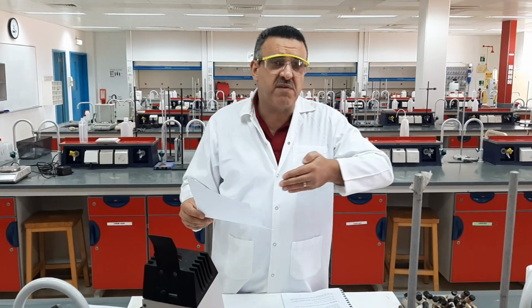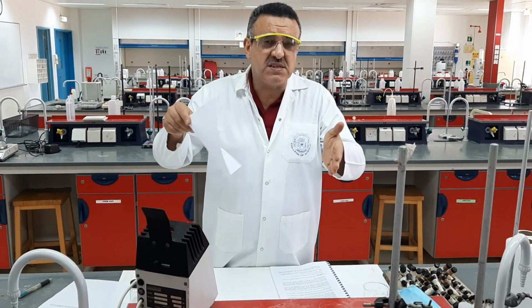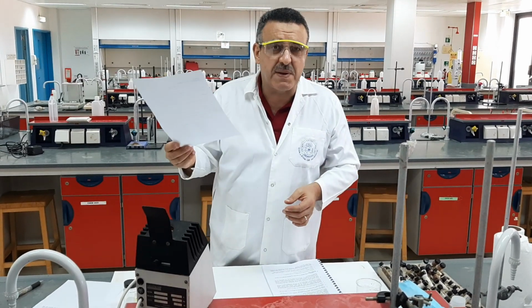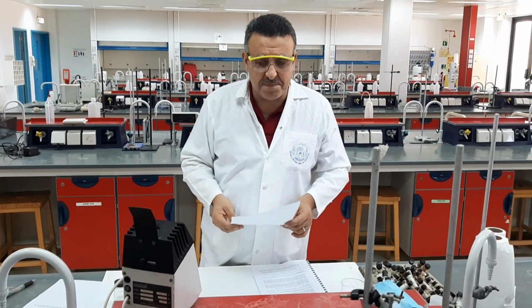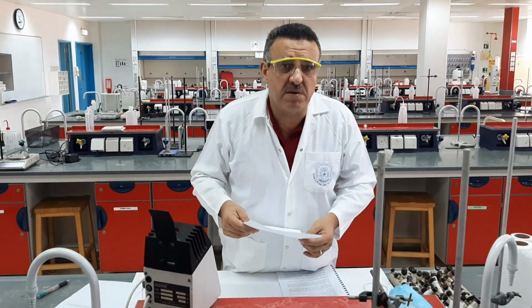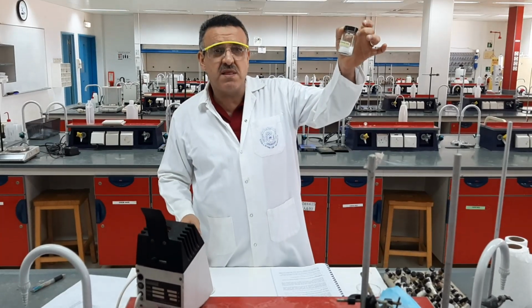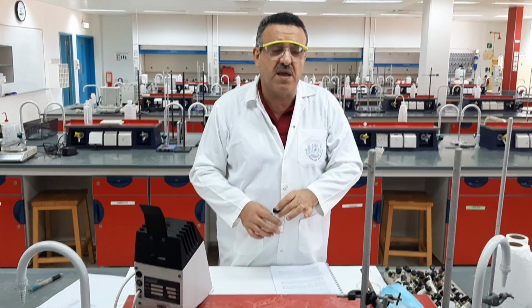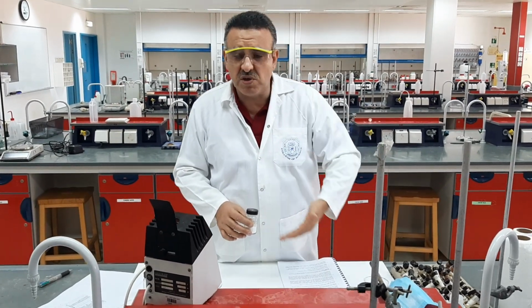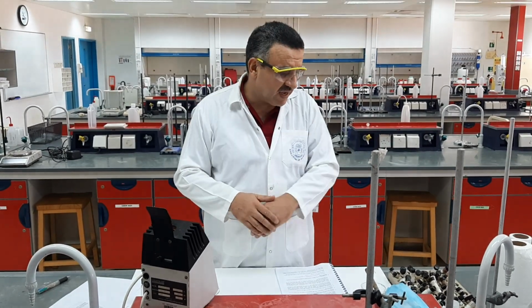Whenever you have a melting range of a compound not exceeding 2 degrees centigrade, then we should expect that this compound is a pure compound. If the range is bigger, then definitely the compound is impure. And that's what you're supposed to do when you determine the melting point of the impure benzoic compound, following steps similar to what you have followed for the pure benzoic acid.